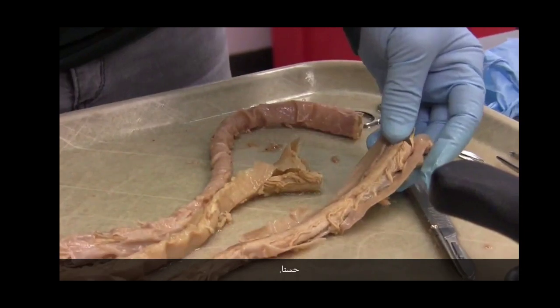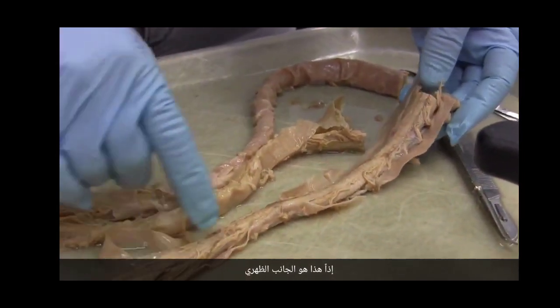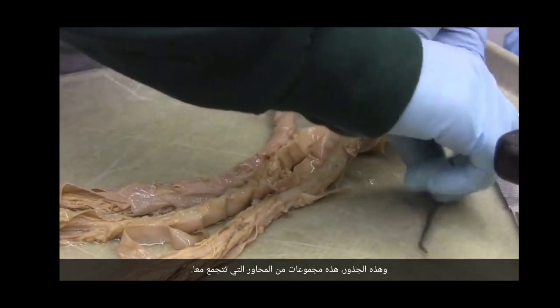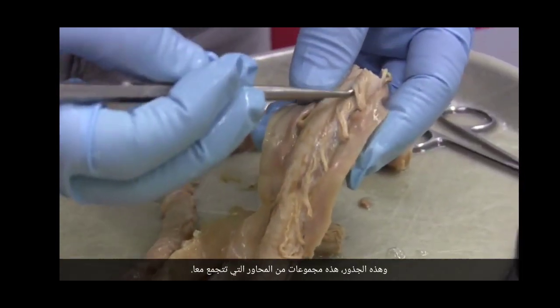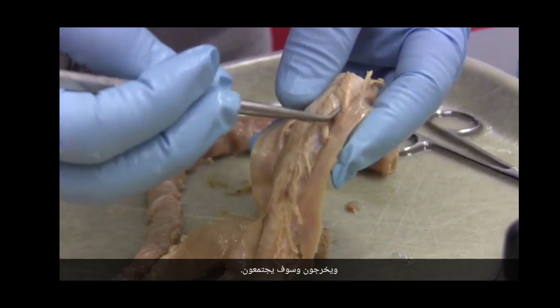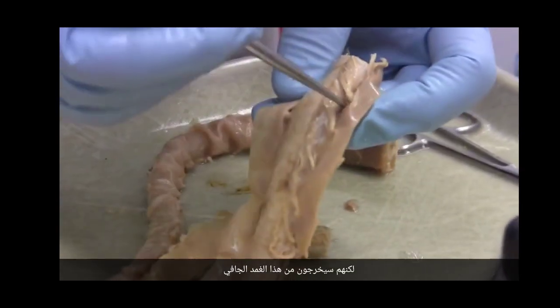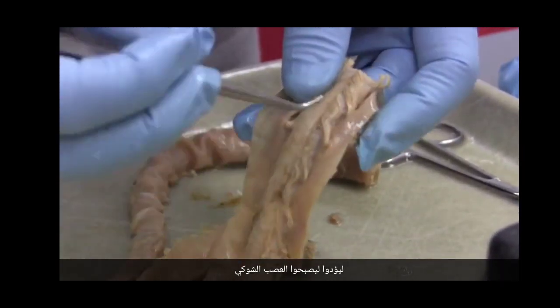Okay, so this is the dorsal side. This is towards the back of the spinal cord. And these roots are bunches of axons that group together. We call them fascicles or rootlets, and they're going to gather, but they're going to exit this dural sheath to become the spinal nerve.